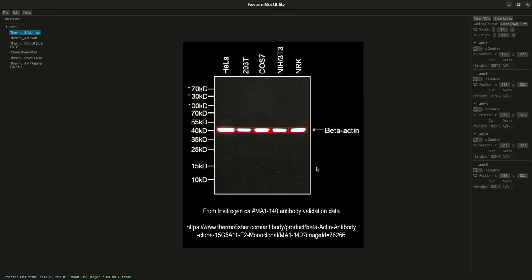So that covers deletion. And let's say, all right, you got the right lane count, you got the right ROI count. You need to just move a ROI because it's not satisfactory. Like let's say this one's up here, right? Obviously that's not where we want it. So you can click and drag any ROI to then position it in the desired location.